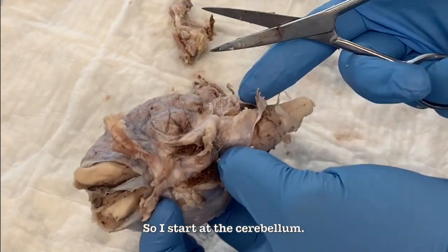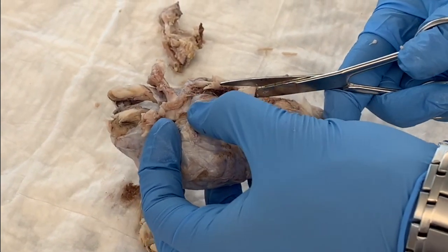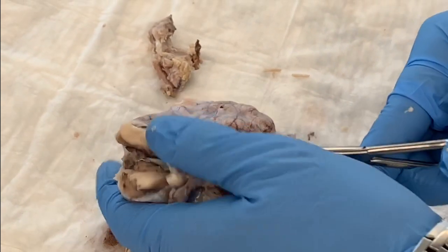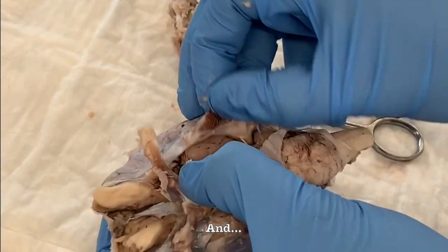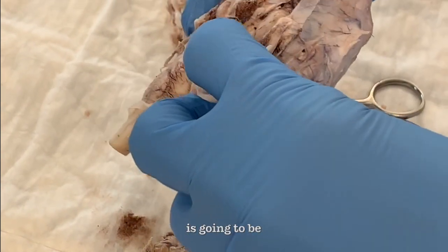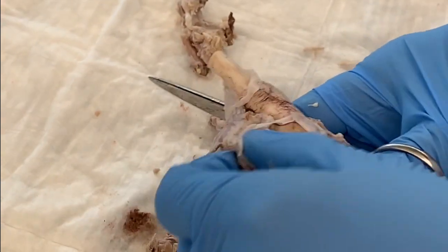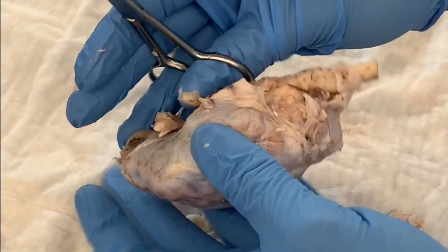So I start at the cerebellum, and notice that right here is the pituitary gland, and I'm going to cut around it because we want to keep it intact while we examine the brain. And so I just cut around it. And if you notice, this part of the meningeal layer is going to be especially tough, and I'm going to cut a little deeper there. And whatever I did on this side, I'll repeat on the other side as well.